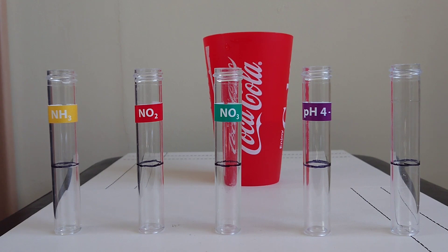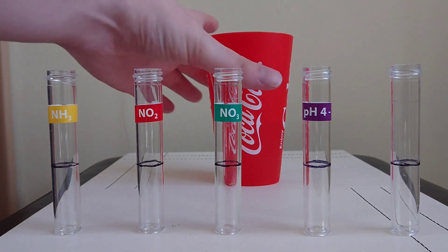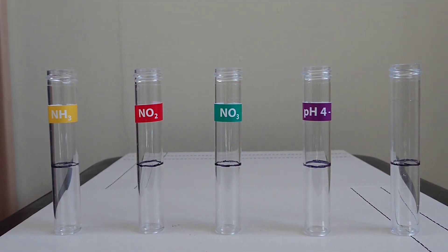I've prepared a cup of tank water. Now what we want to get is a pipette and then enough water to fill up to the five milliliter line.